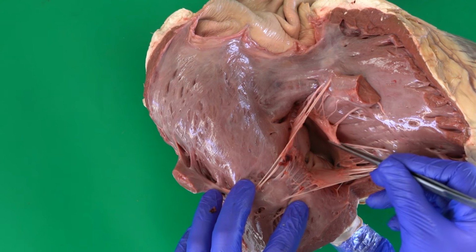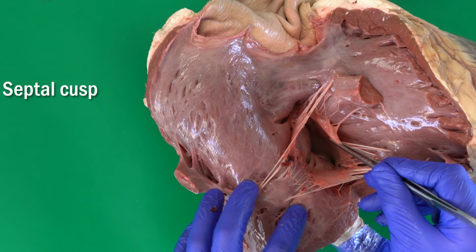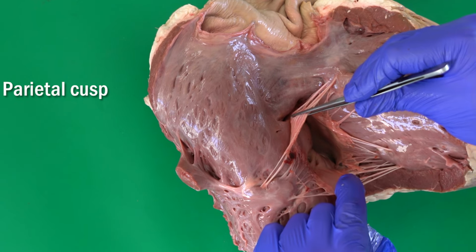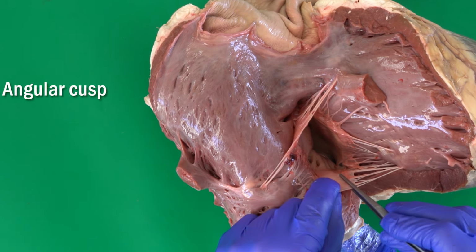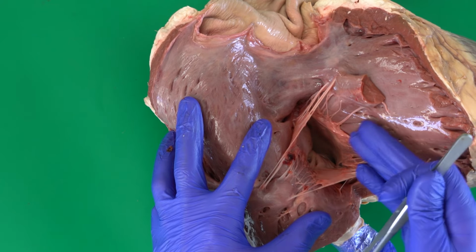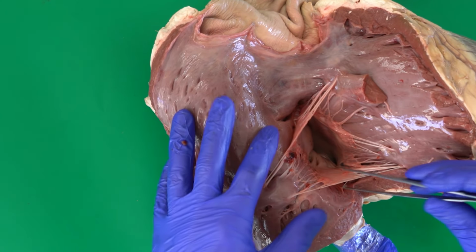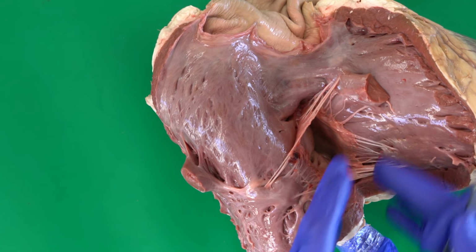The one next to the interventricular septum is called the septal cusp. This one here is the parietal cusp, and this one here is the angular cusp. So again, the one next to the septum is the septal cusp, the one toward the wall is the parietal cusp, and the one in between is the angular cusp.